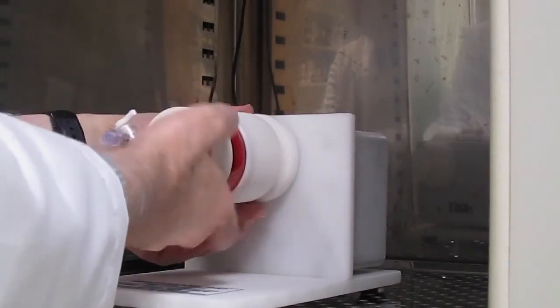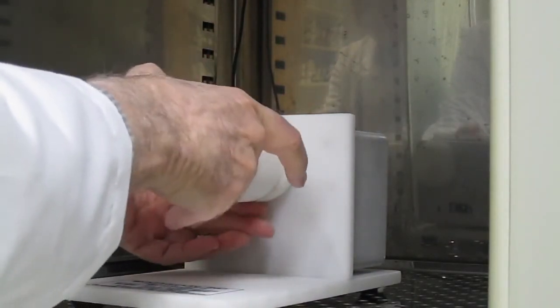It's not necessary to over tighten this either. Just snug.